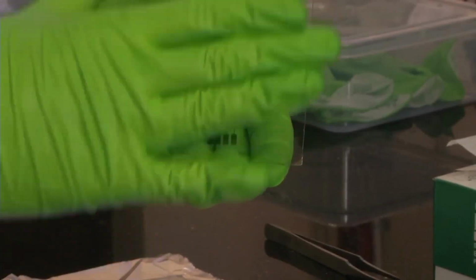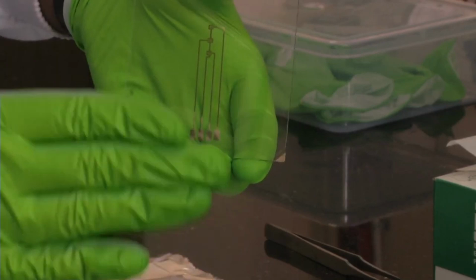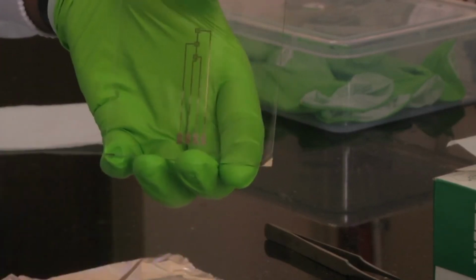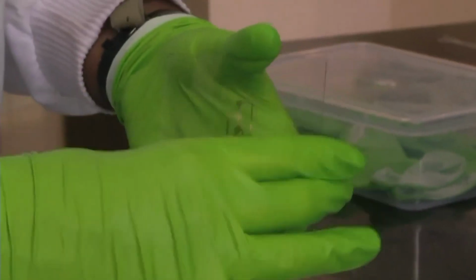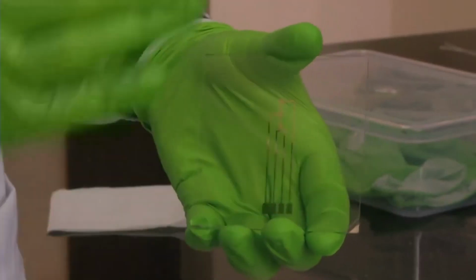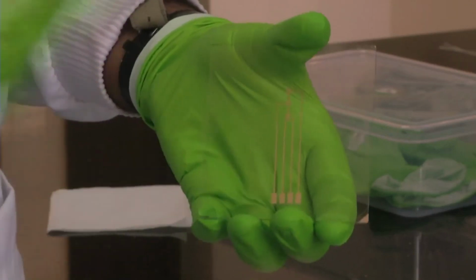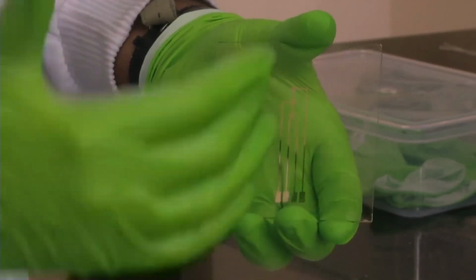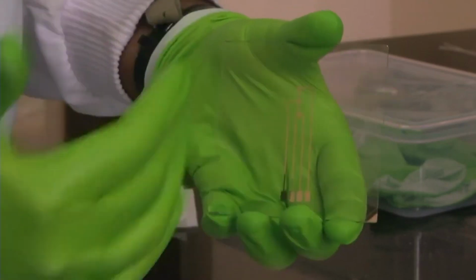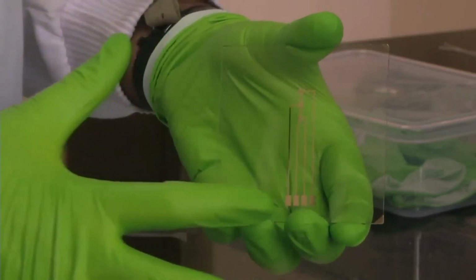What we will do, we have to first clean the glass slide properly so that there are no contaminants. Then we have to coat it with gold, so you can use methods like sputtering, which you have learnt in the theory. You sputter a fixed thickness of gold on the glass slide, then you pattern it after doing PR coating and then exposure using a mask aligner or a general photolithography machine, and then you form your pattern. Then once your pattern is formed, you will etch off the remaining gold using a gold etchant like KI. So then finally you will have your gold electrode.